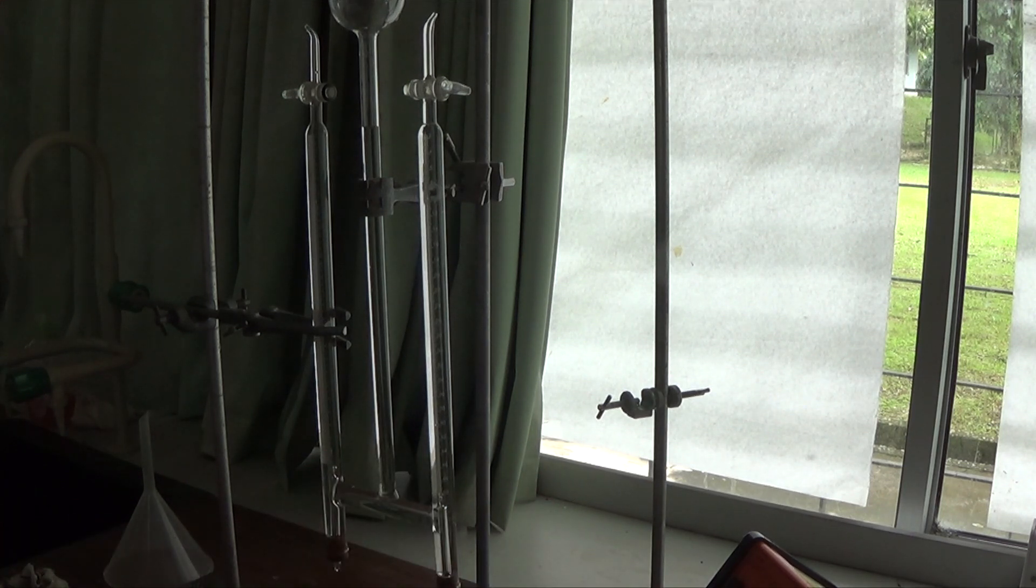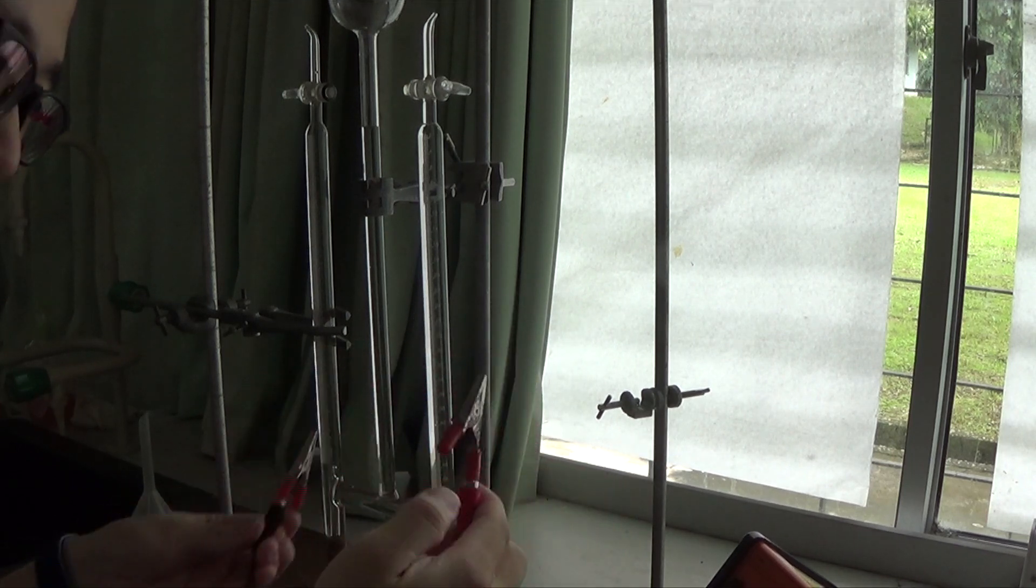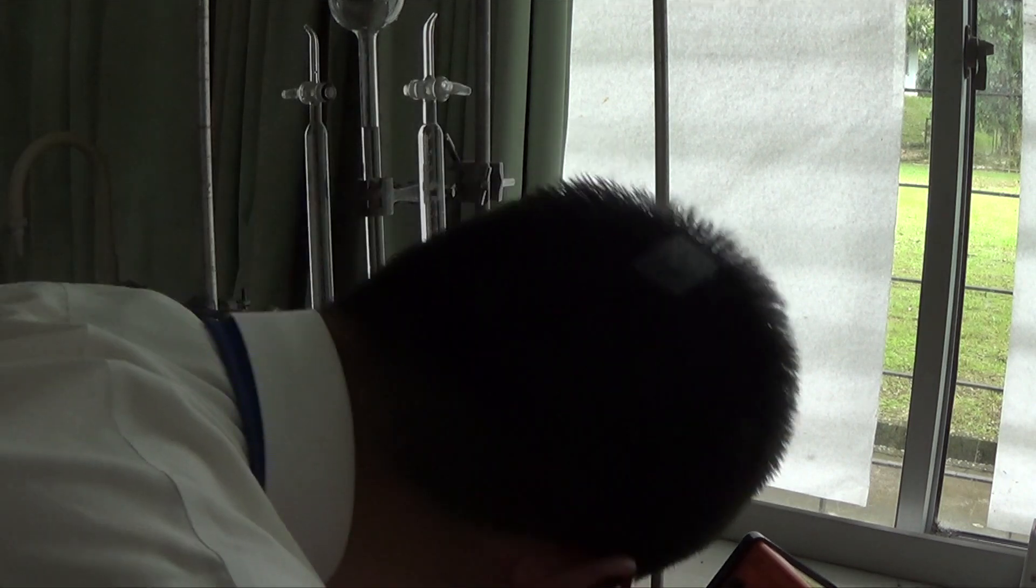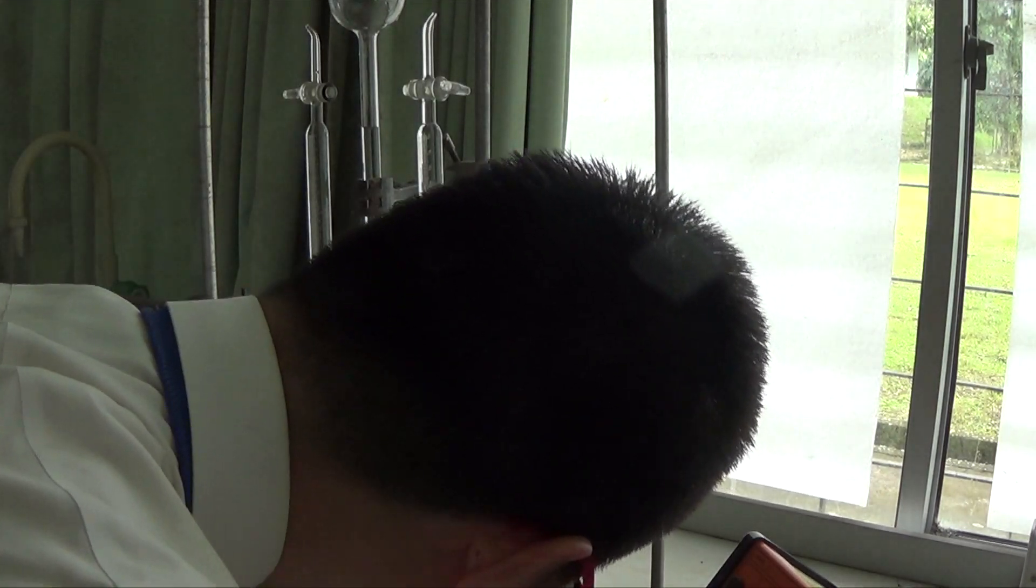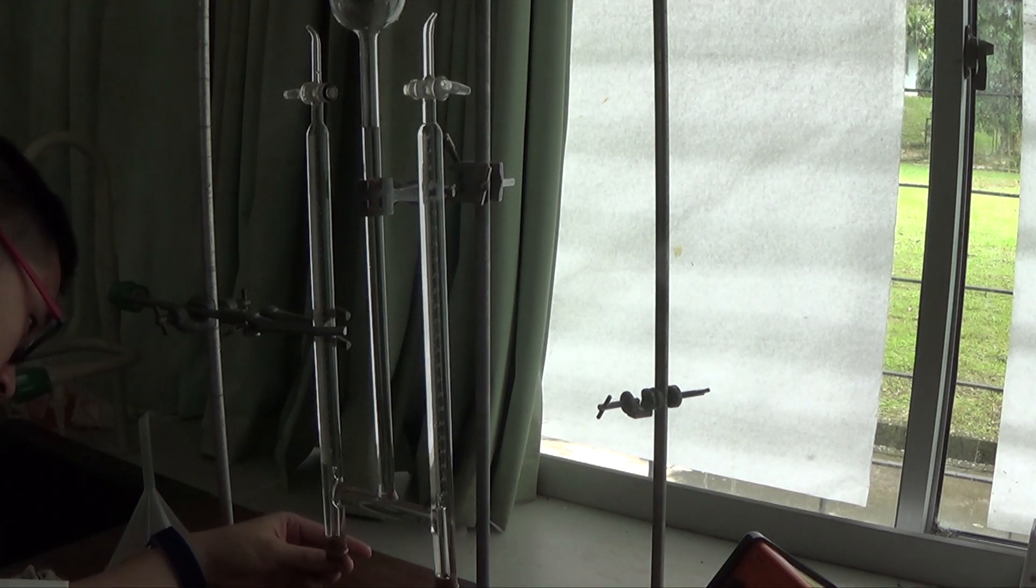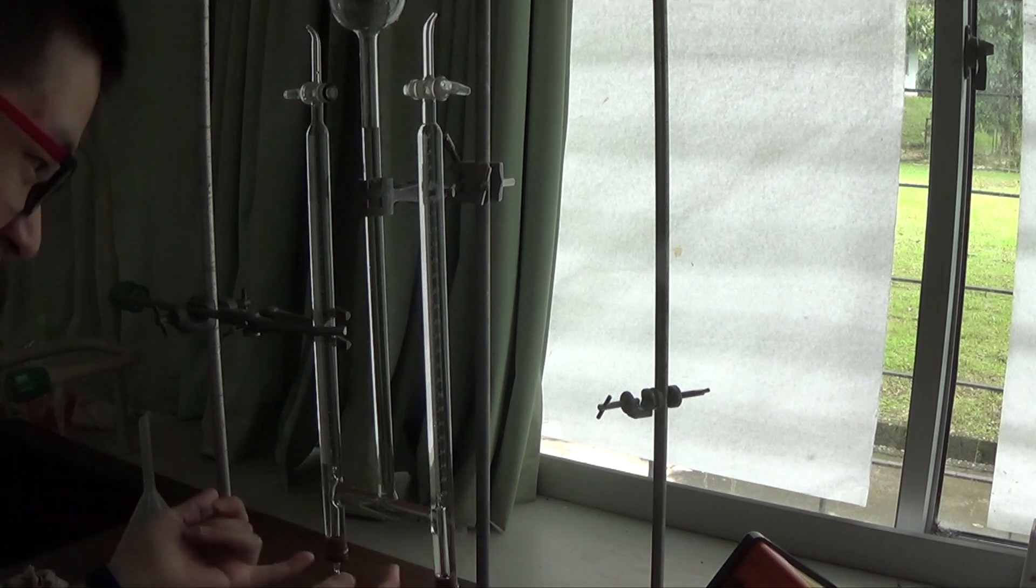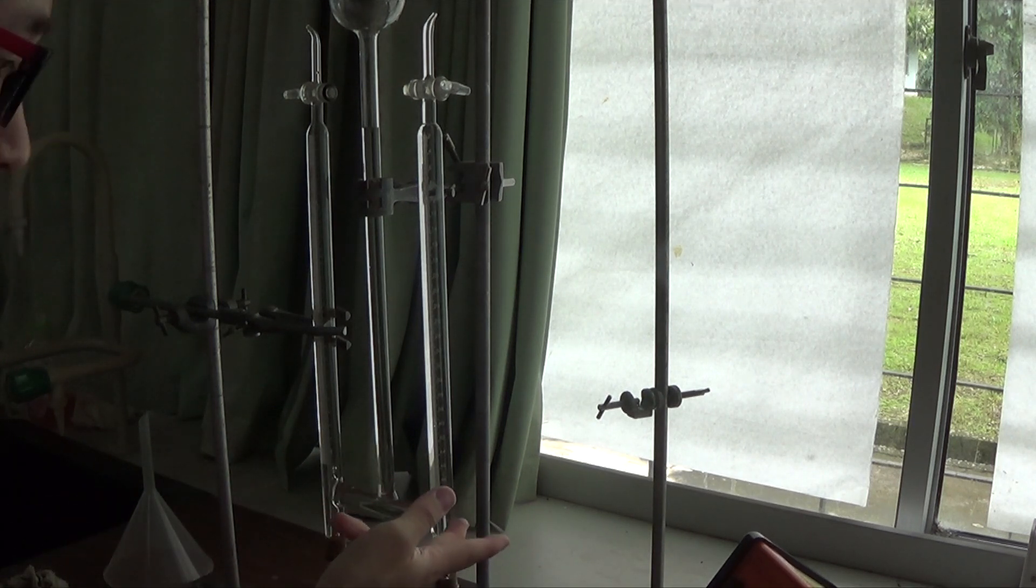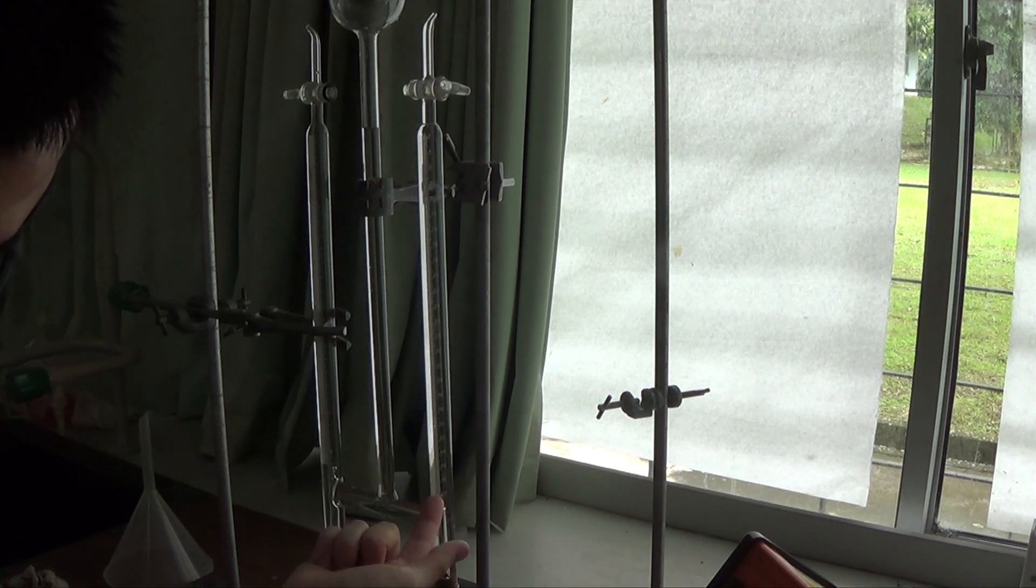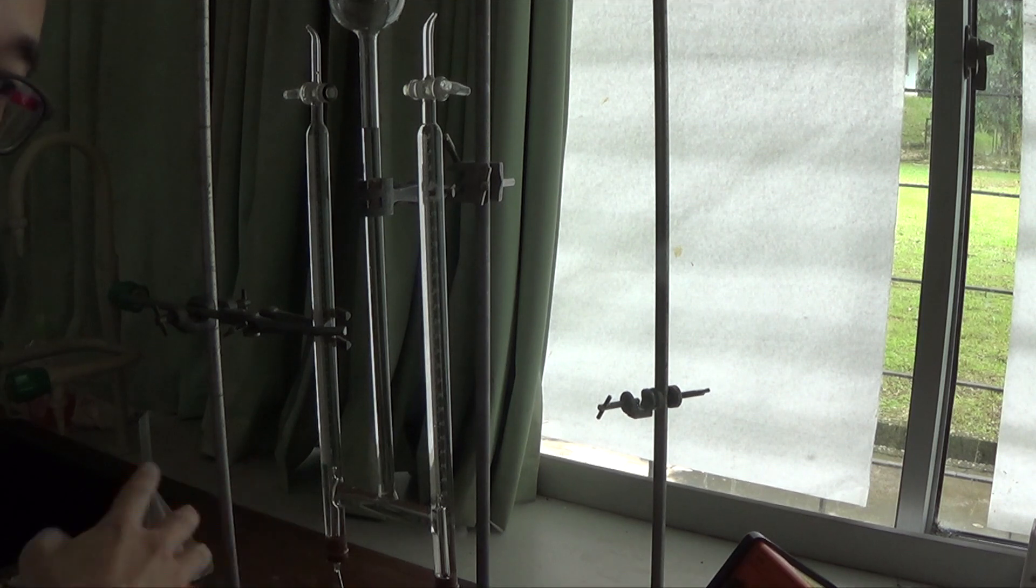We don't touch with bare hands. We use these crocodile clips. These are rubberized or plastic end here. So we're going to put this here. It's like a metal clip at the bottom. It's connected to a platinum electrode. This is expensive metal. These will be the electrodes. They actually allow the conduction of electricity and split up your stuff here.